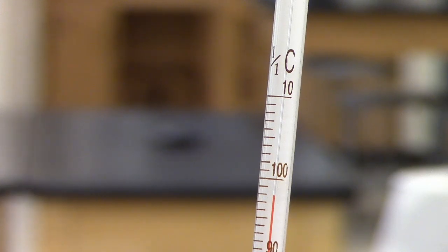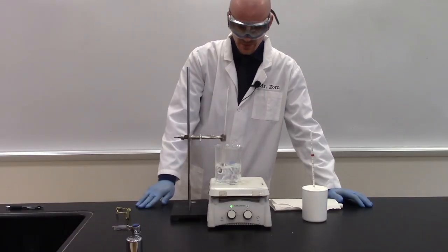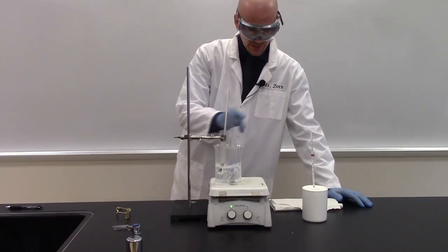We're going to continue heating until we get as close to 100 degrees Celsius as possible. Once our temperature is stabilized, we need to then transfer our metal to our calorimeter.